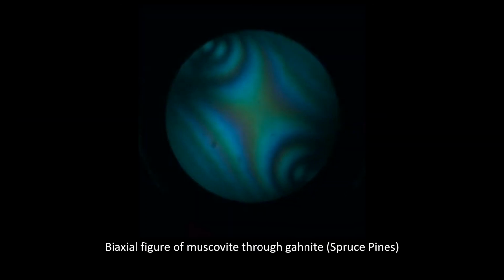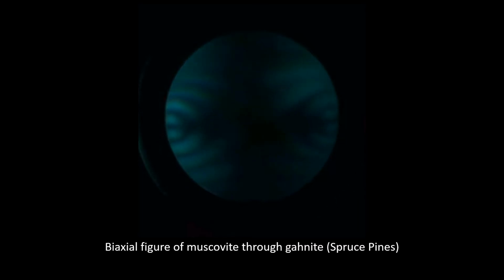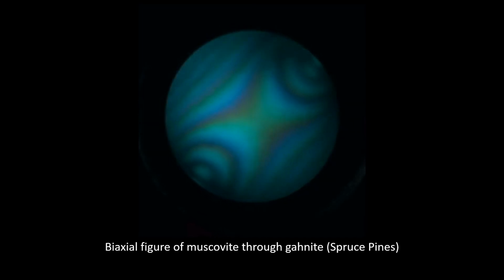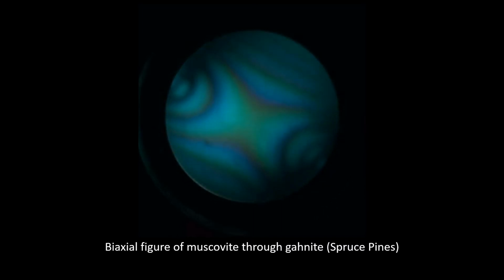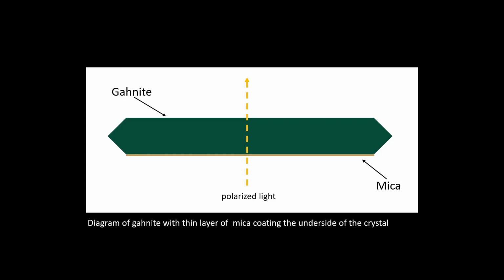Here is the original interference figure that we observed and reported for the gahnite. While you again would expect to see nothing if trying to get an interference figure, here you see a very clear, distinctly biaxial character. However, further research indicated that this interference figure actually belonged to the residual layer of muscovite mica that we found on the underside of the gahnite crystal, meaning that the results noted in Rocks and Minerals magazine are incorrect. So the gahnite in this case acted pretty closely to glass.